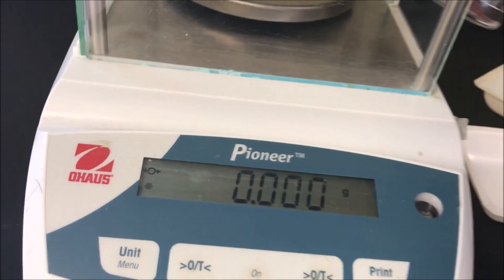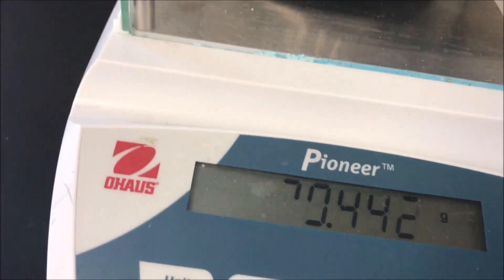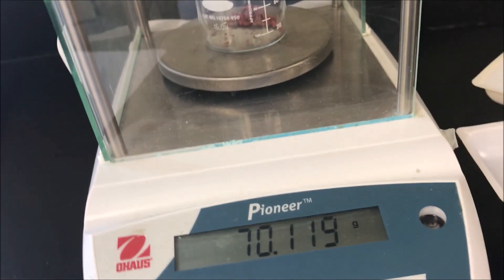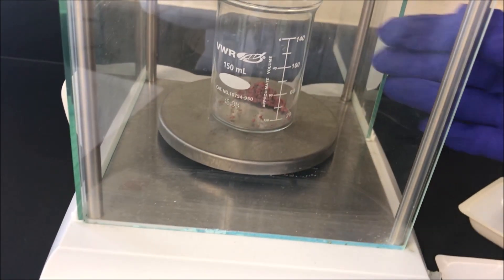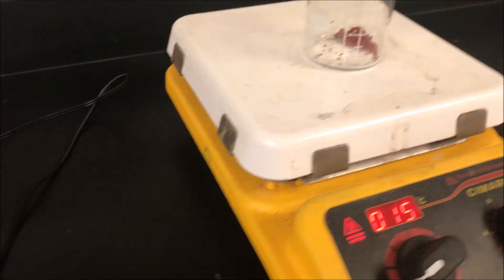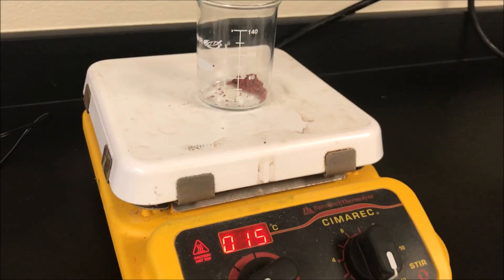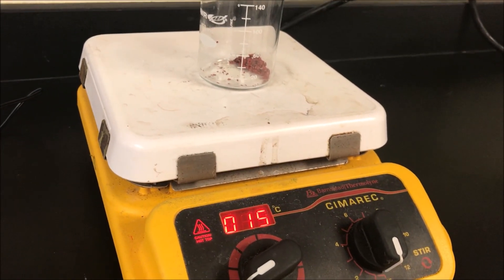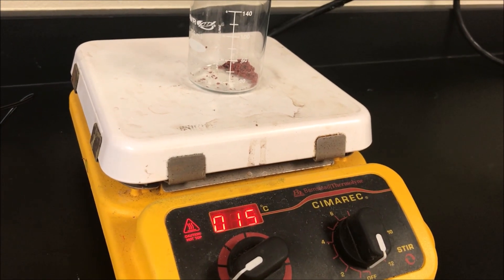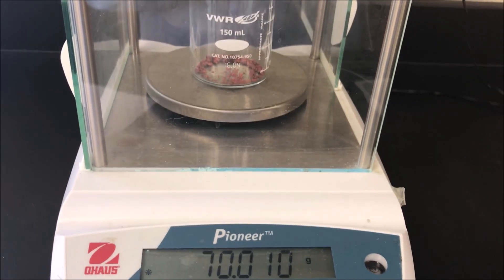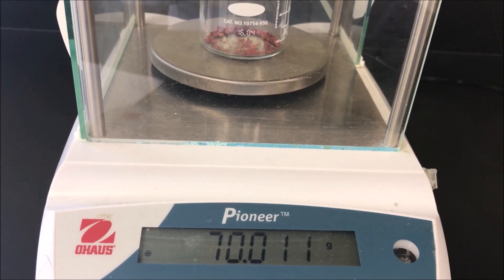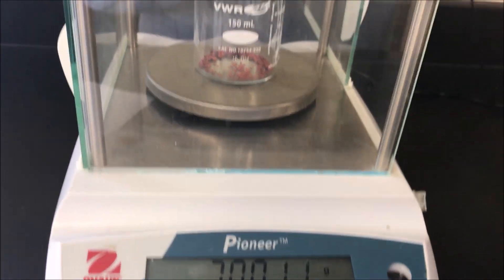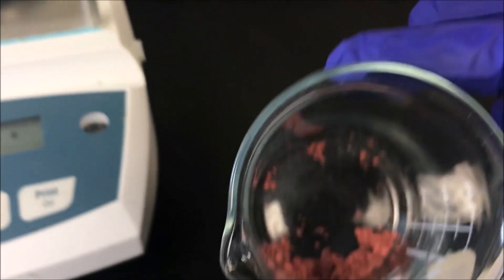After drying, we find the weight of the beaker with the copper again and note down the reading: 70.119. Then make it dry some more and after five minutes we weigh again for the second weight. The second weight is 70.011. This is our final copper product.